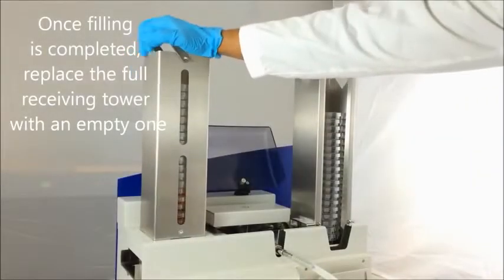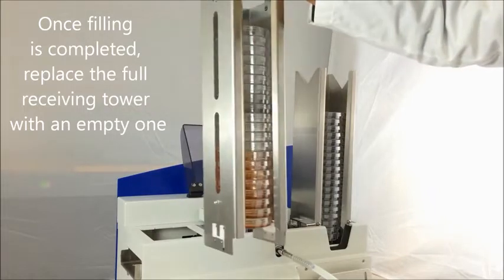Once filling is completed, replace the full receiving tower with an empty one to continue filling.